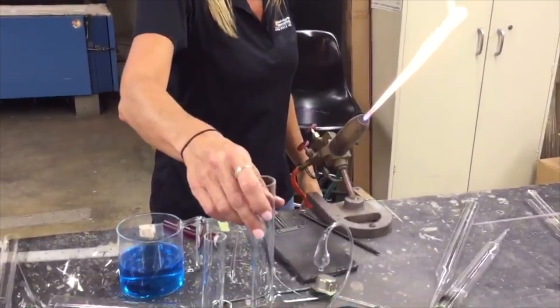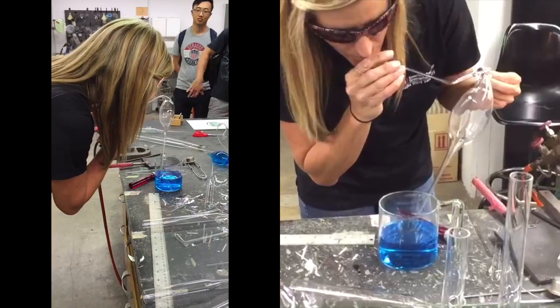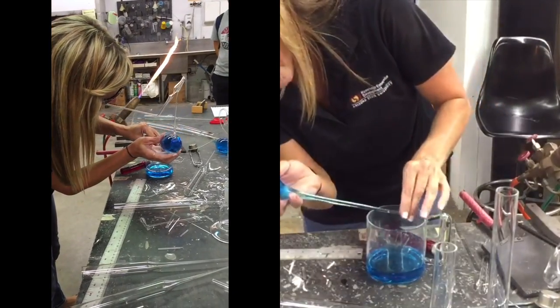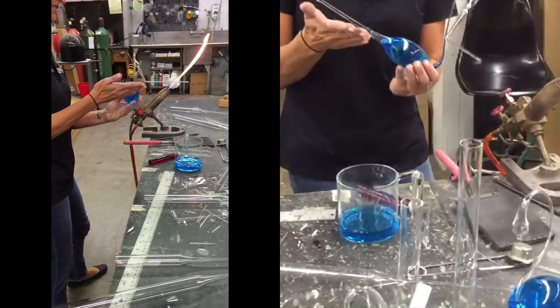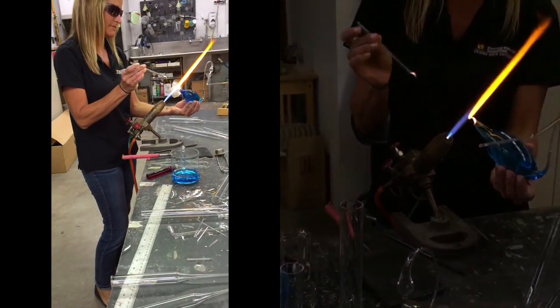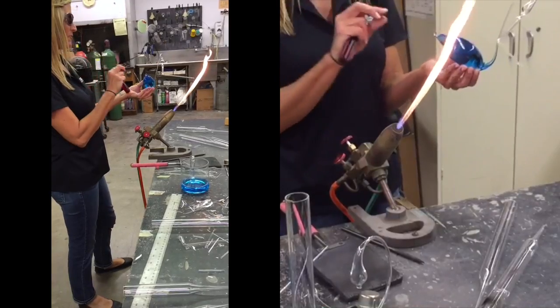If you guys think of anything you need made for your research, or if you break anything, don't panic — bring it here. So this is just water with food coloring; I'm going to use this like a silly straw and fill it in. I'll seal off the tail and pour it off a little more. We'll let that cool briefly, otherwise I've had it happen before where the water just shoots right out.